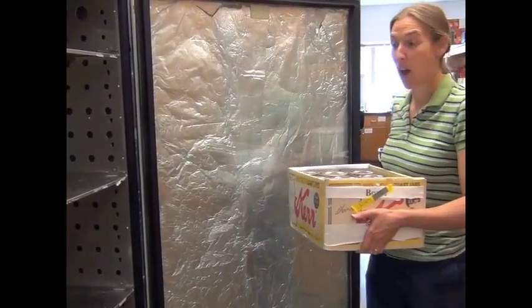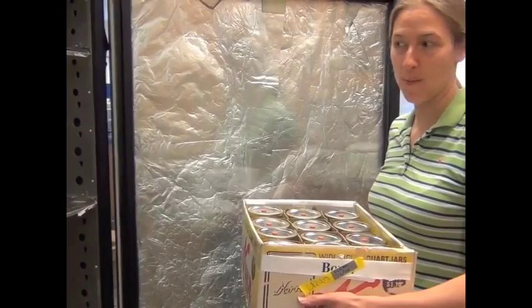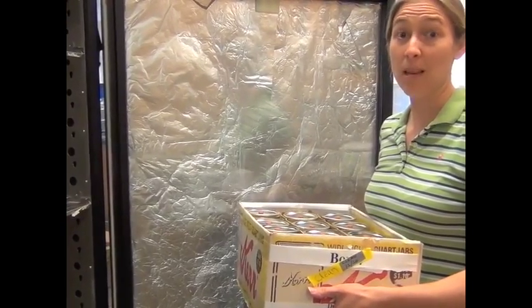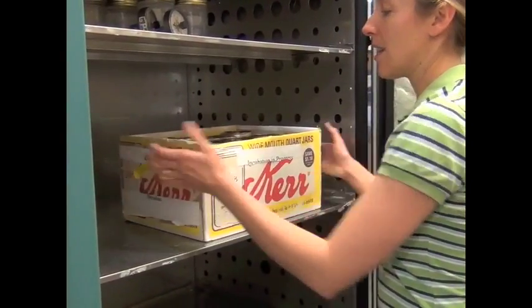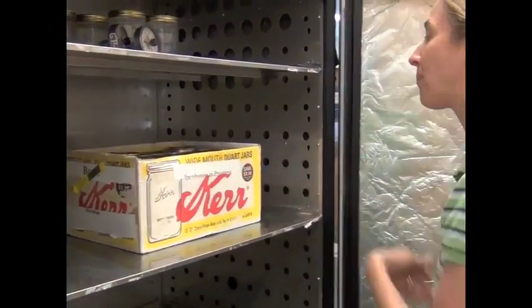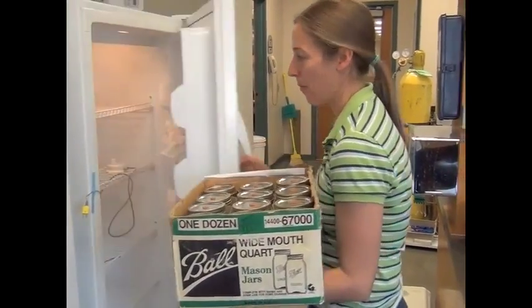So we have weighed out our soils, wet them up, sealed them in jars, and taken the time zero measurement. Now we're going to put them in the incubator. So this is our 35-degree incubator. So we're going to have one set of soils that's incubated at 35 degrees. Seal that up. We've got our other set of samples that we're going to put in our 15-degree incubator.